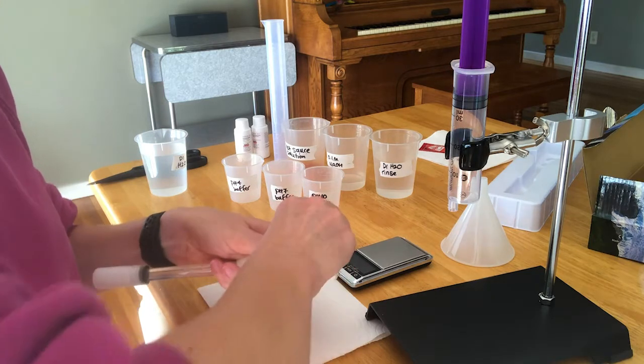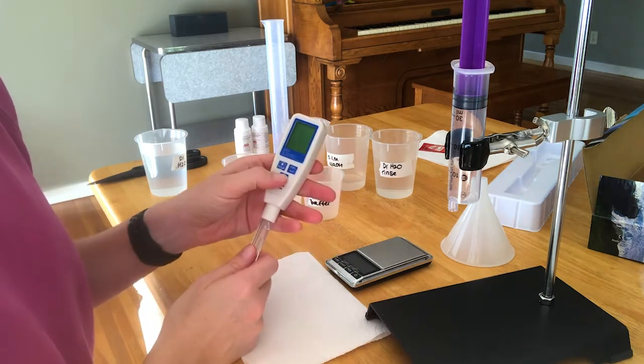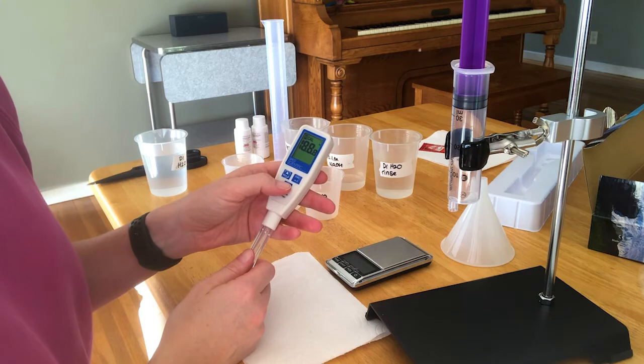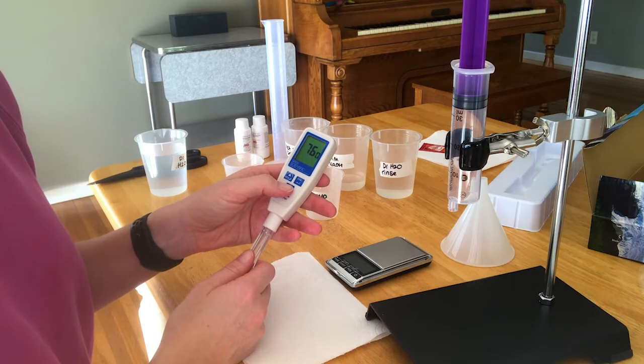Then go ahead and twist it to the left to make sure that it's closed. Then you just have to press the start button or on.